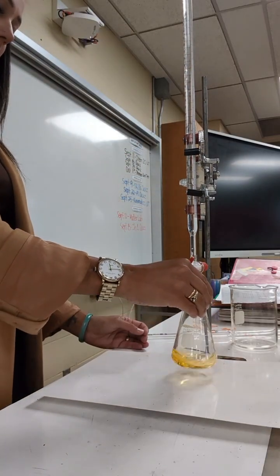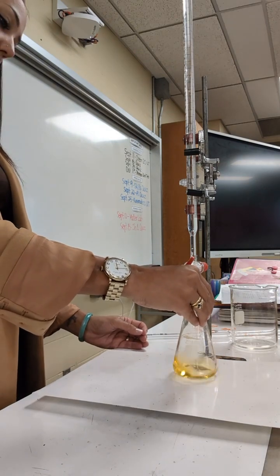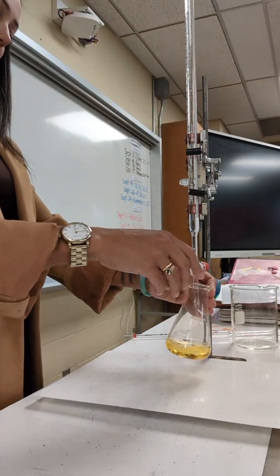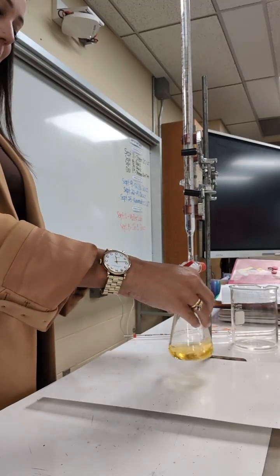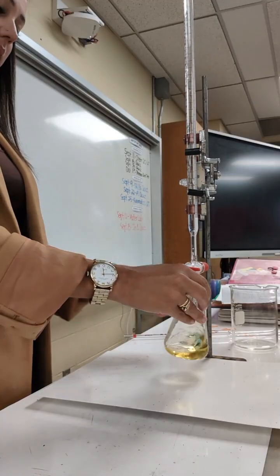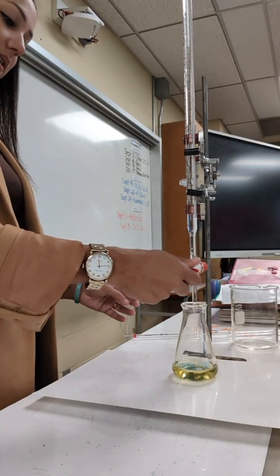So technically in a titration, you should go drop by drop, but that can take a while. So trial 1 usually gets thrown out and it just gets you to the area you need to be, and you can be more careful in trial 2 and 3. So in my first trial, I know I'm getting closer to my endpoint when that blue color that's appearing sticks around. So like right now it's sticking around a little bit more. This would be a good point to go drop by drop.